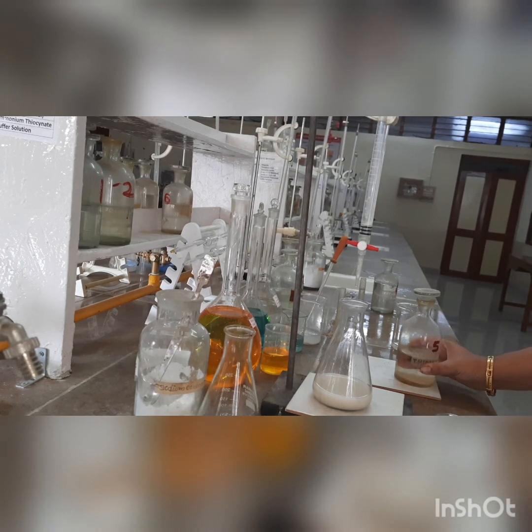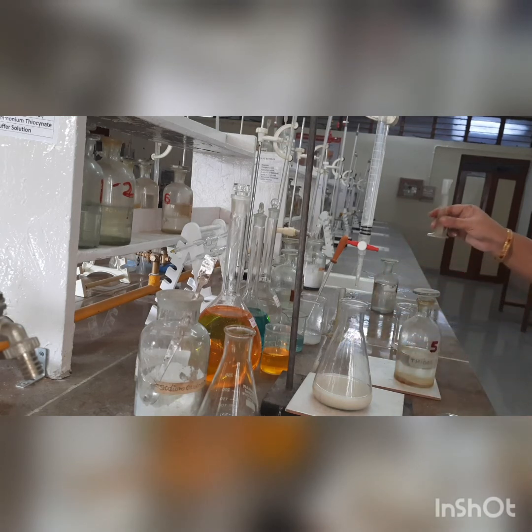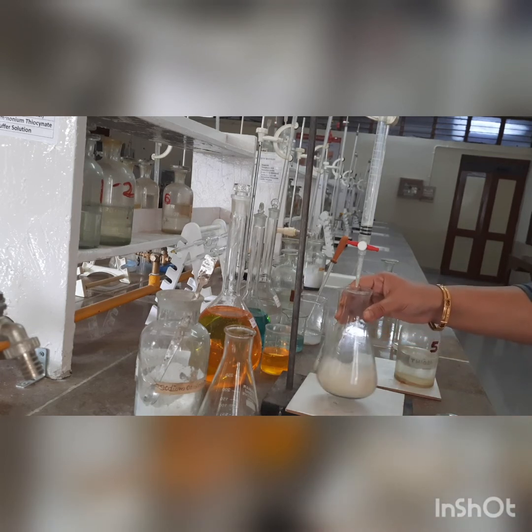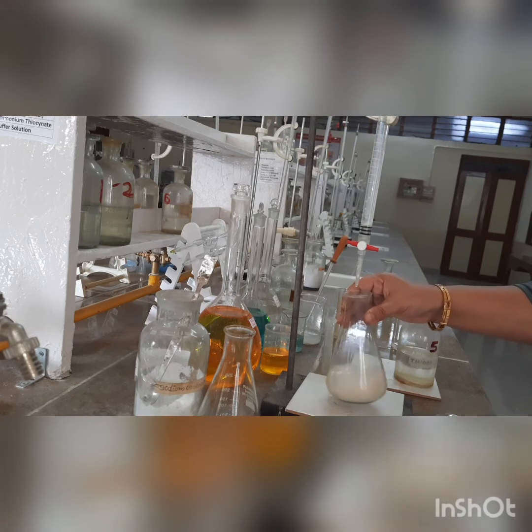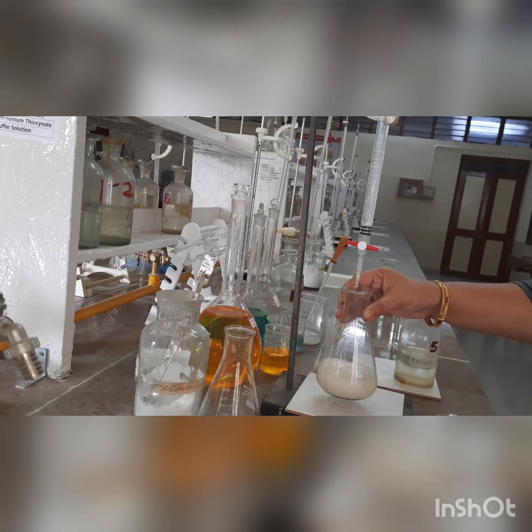We will keep this solution for some time and finally we are going to add ammonium thiocyanate — 10 ml of it — just to make sure that there is no iodine left over in the sample with starch. If any iodine remained with starch, again a black color would appear, which has not happened. This means that our titration is complete. So this is the second part.